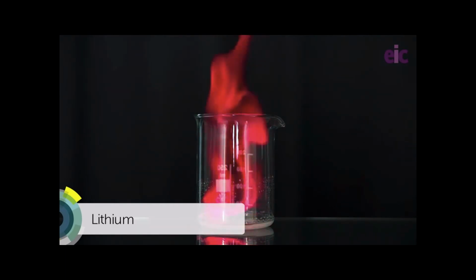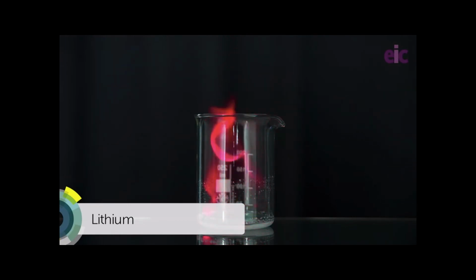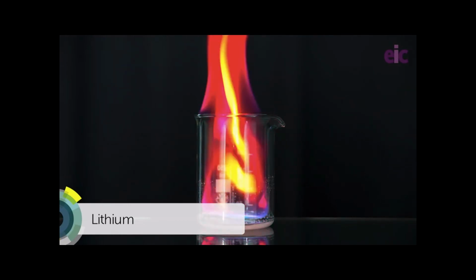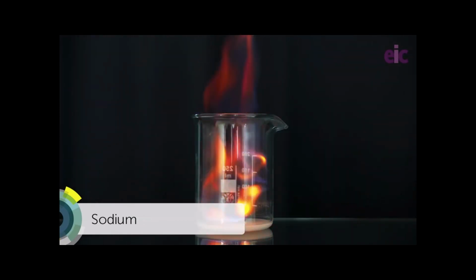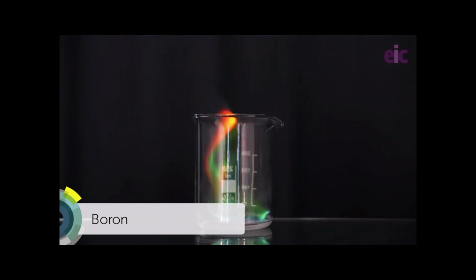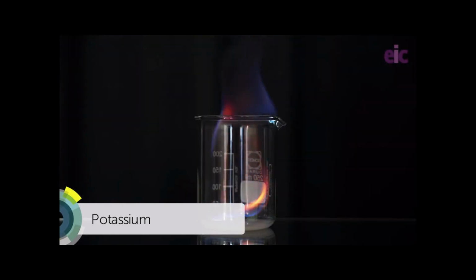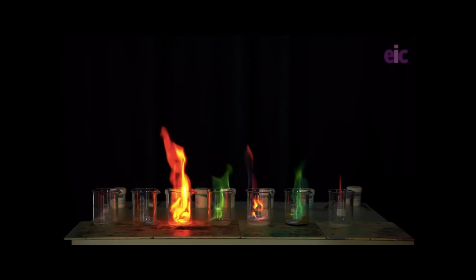So what we saw in the previous clips was this. They're burning metal ions. So lithium burns red, sodium burns orange, boron burns, looks like a green and a little bit of yellow there. Copper burns bluish green. Potassium burns, looks like blue.